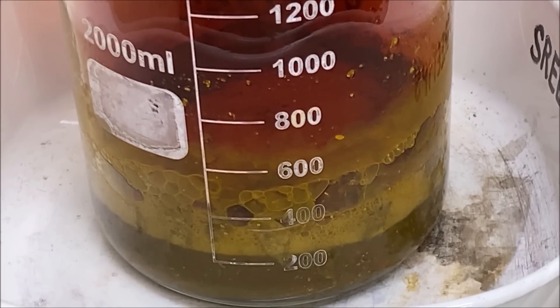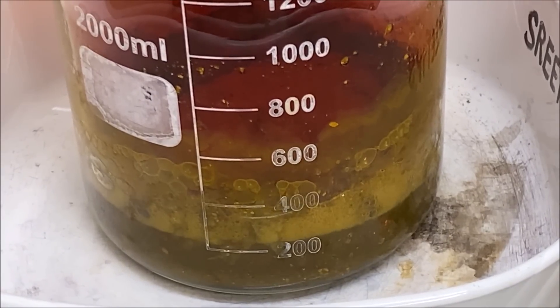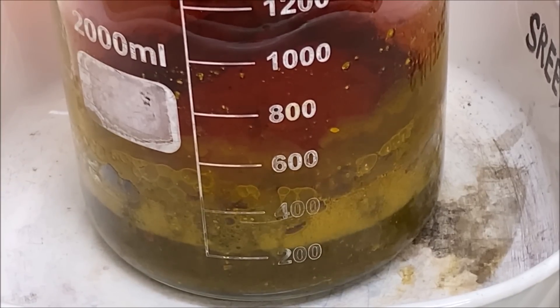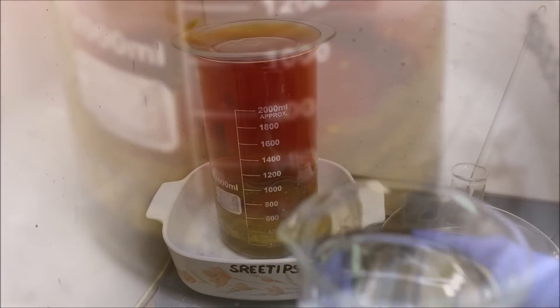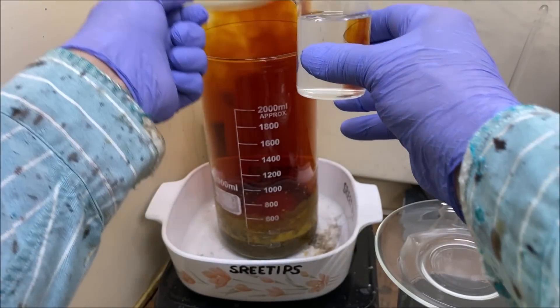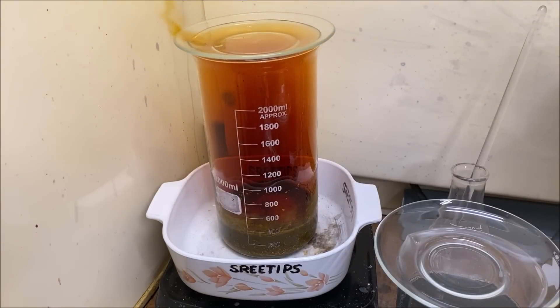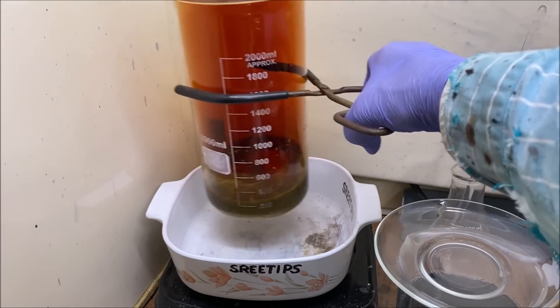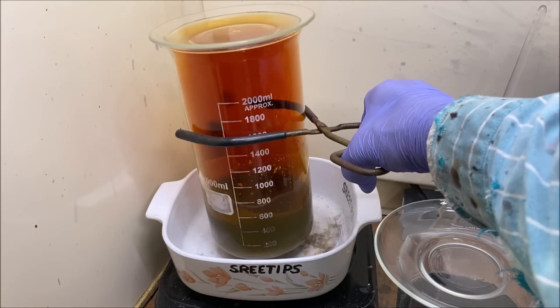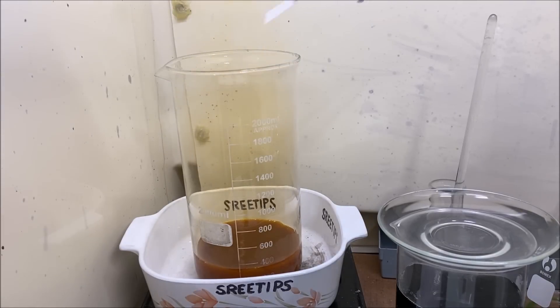I'm trying to remove the silver by dissolving it in hot dilute nitric acid. I don't know if that's going to put the DMG precipitate back in solution or not. I've got some distilled water here — I'm just going to hydrate this material and let it cook for a while to see whether or not I'm going to be able to pull the silver out with hot dilute nitric acid.